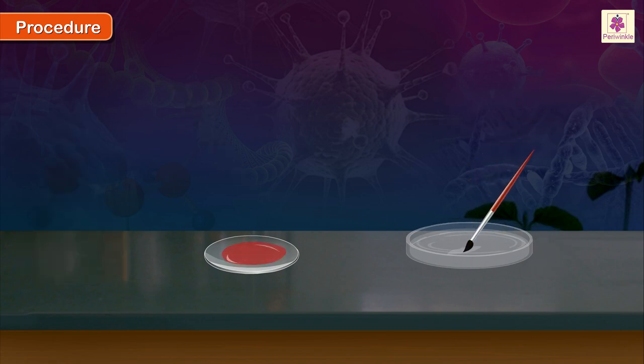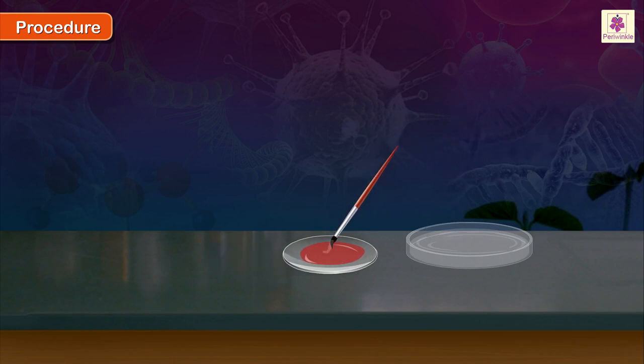Use a brush to transfer the smaller piece of the peel to the watch glass and let it remain flat, unfolded, for about a minute in the stain.